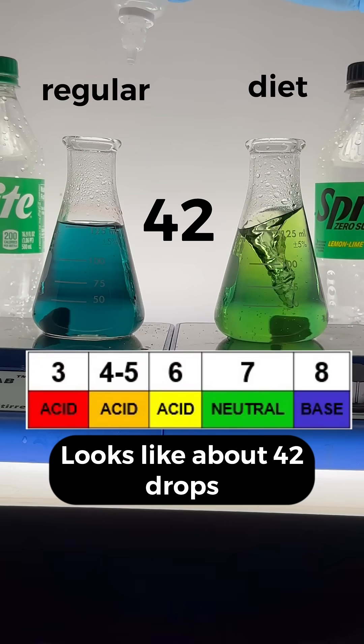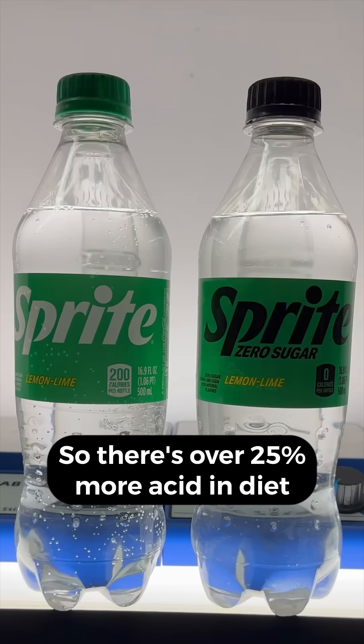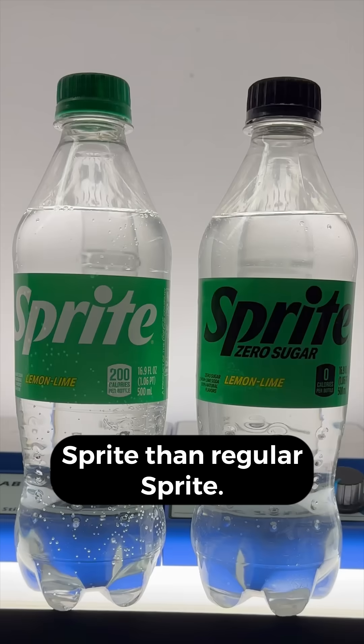Looks like about 42 drops, so there's over 25% more acid in diet Sprite than regular.